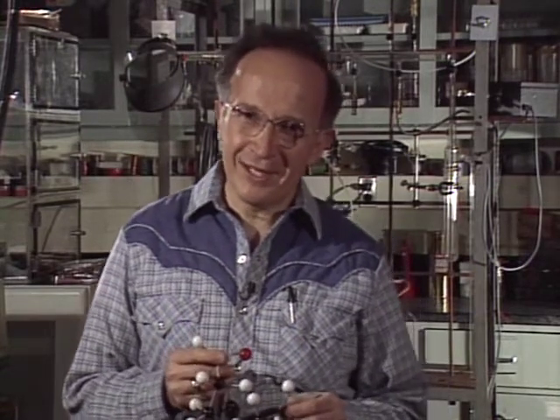There's something interesting about this in that none of these measurements by itself proves the entire structure of the molecule. What we get are clues, a partial revelation. What it takes is a chemical detective, the mind of an inquiring, puzzle-solving man or woman to piece together from these clues the intricate structure of something like the gypsy moth pheromone.